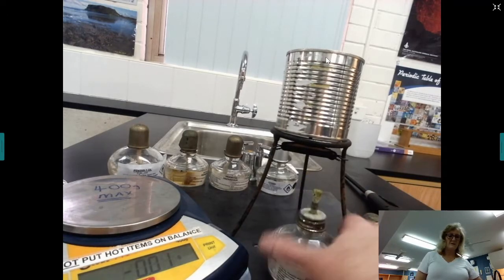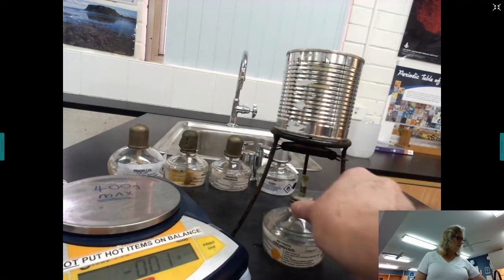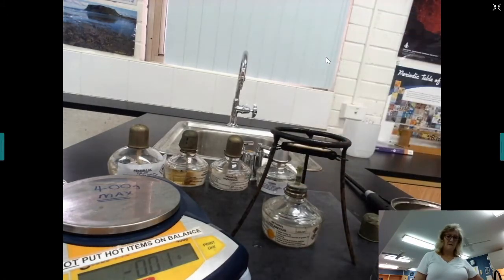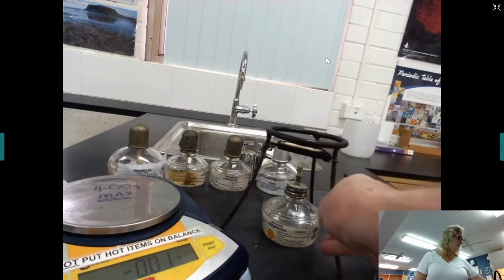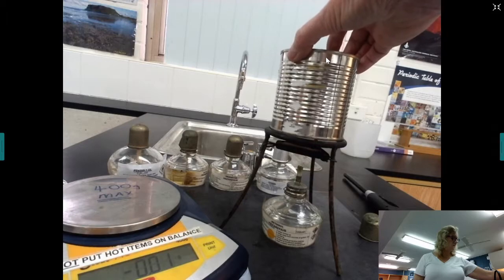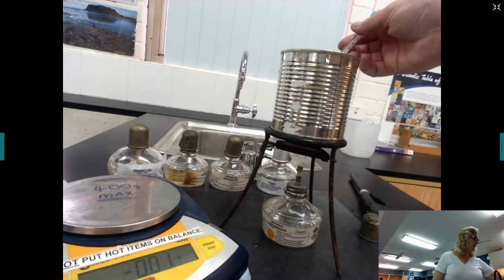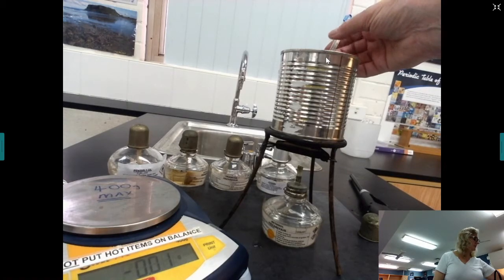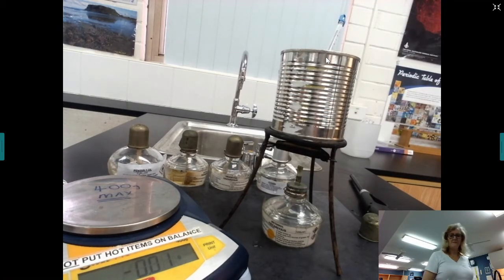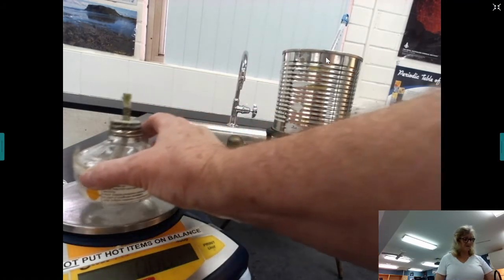So our alcohol is in spirit burners. This one is methanol, and we've just got a mini tripod that's been made up specially for this, and a metal can. Now, I've put 100 mils of water in the metal can, and we need a thermometer in there to record the initial temperature of the water, and we need to measure the initial mass of the spirit burner. So we need to know how much has actually burnt.